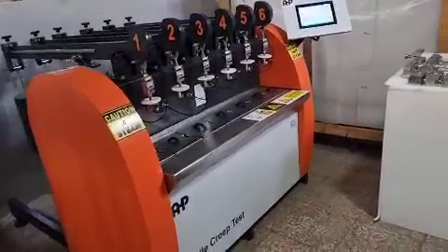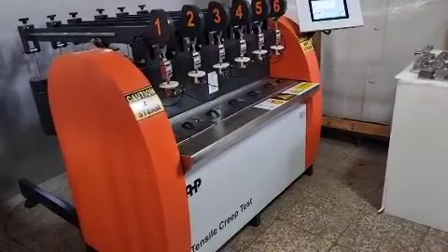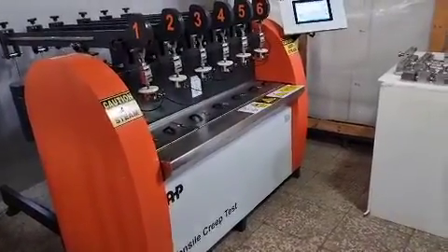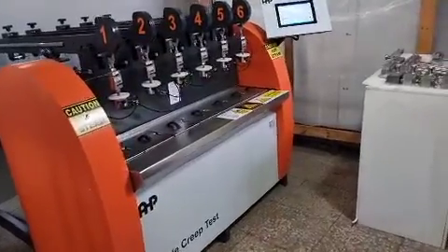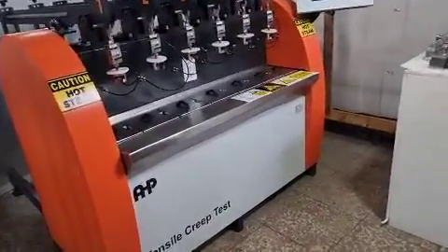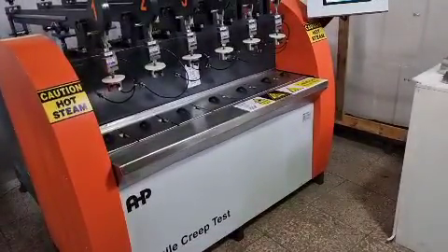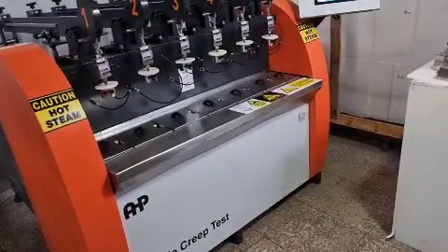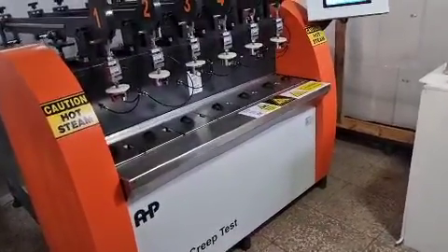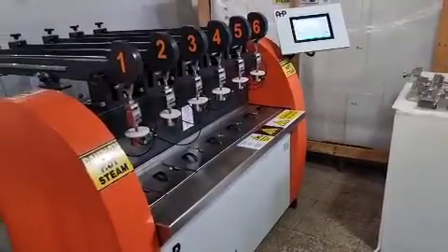Hello everyone. In this video I'm going to show you how to use our tensile creep tester. It is not only a tensile creep tester — it is also usable for full notch creep tests and two notch creep tests according to ISO and DVS norms. This machine is manufactured in all different load capacities in our factory.